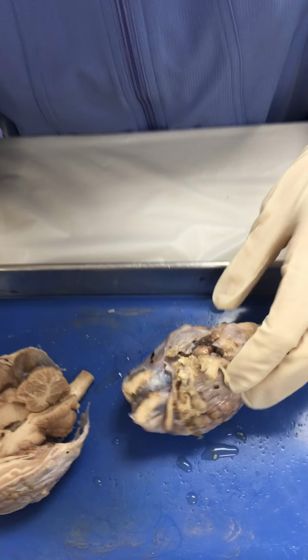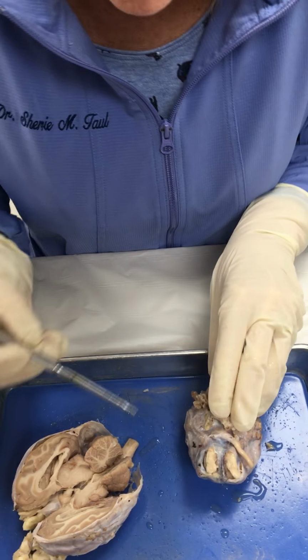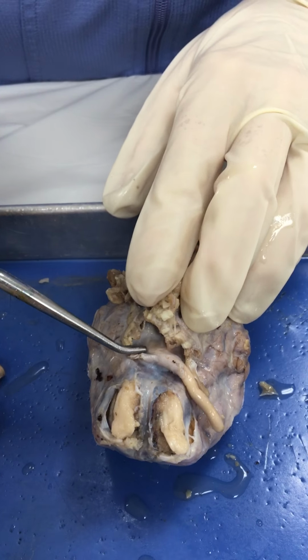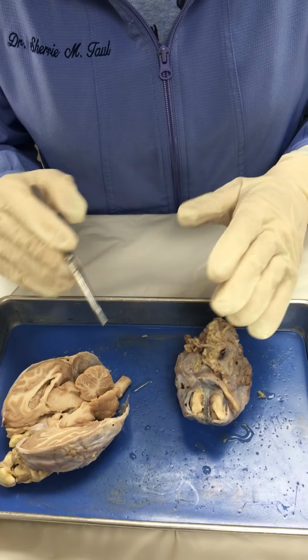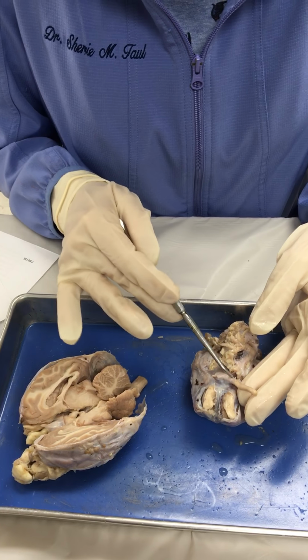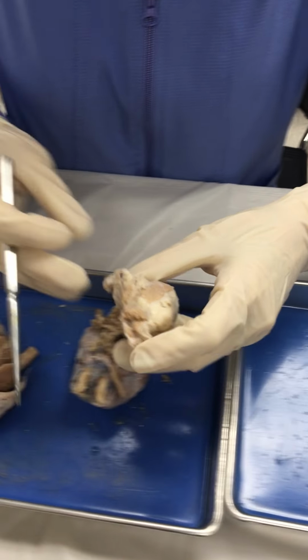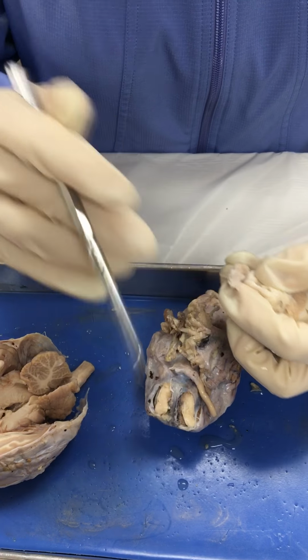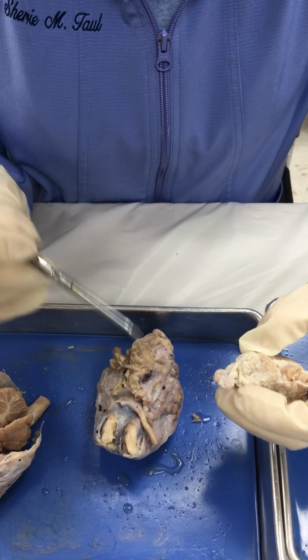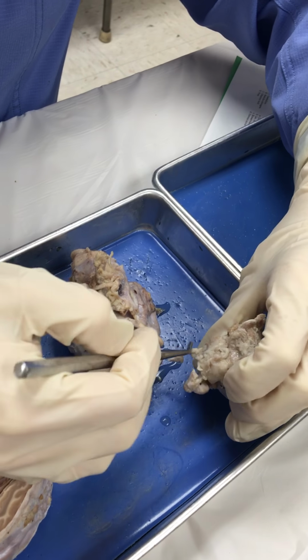One interesting fact, we're not really going to go into a whole lot of the nerves that come out of the brain, but since we've already done the eye and the sheep, this here is part of the optic nerve that goes in to supply the occipital lobe with what the eye is seeing. It interprets what the eye is seeing. We had done the sheep eye earlier, and we have the optic nerve coming out of the back of the eye that we had looked at earlier. And actually this would be attached to this area of the brain.